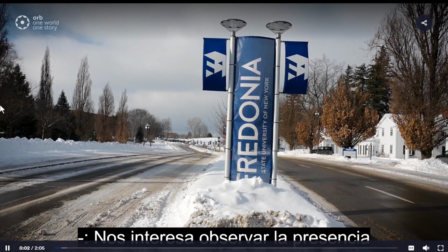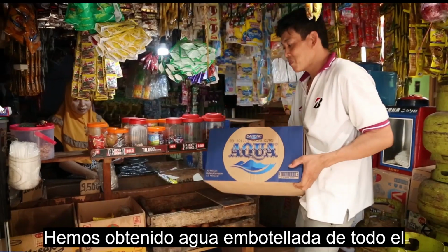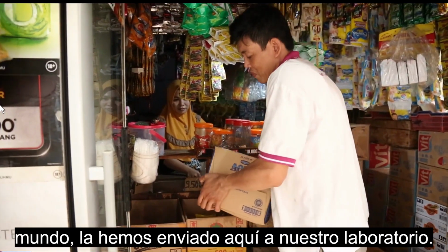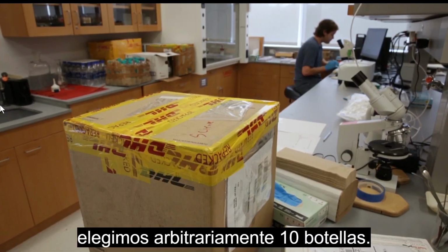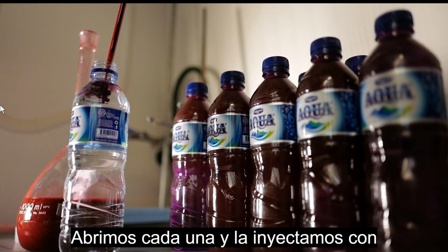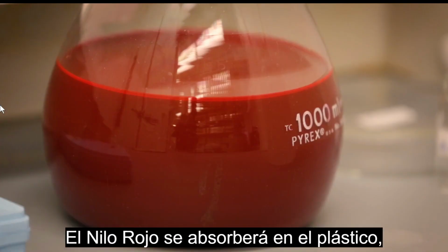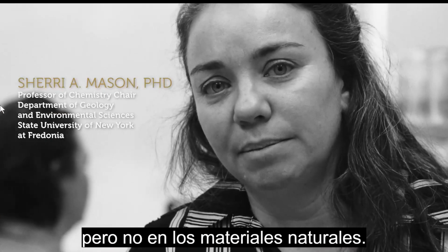We are interested in looking at the occurrence of plastic particles within bottled water. We have obtained bottled water from throughout the world, had it shipped here to our lab. From each case that we have received, we arbitrarily choose 10 bottles. We open each one and inject it with a Nile red dye. Nile red will adsorb onto plastic but not onto naturally occurring materials.